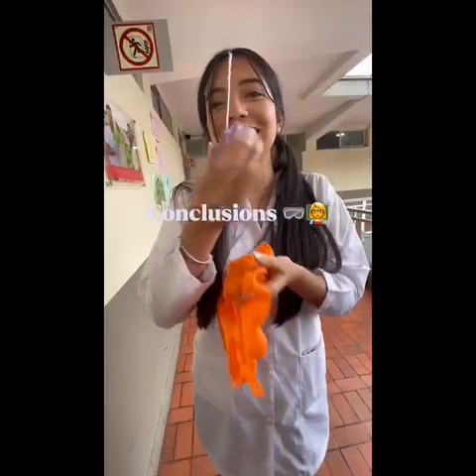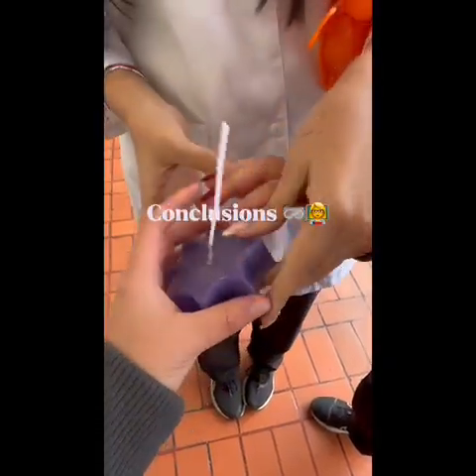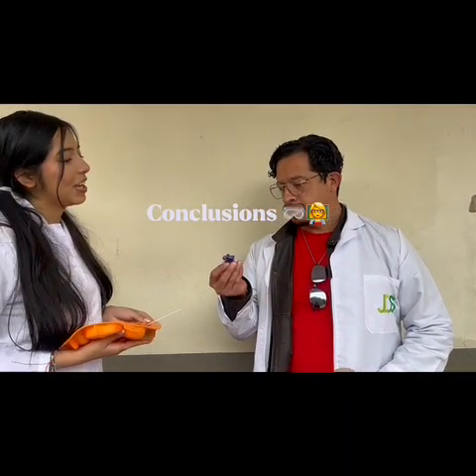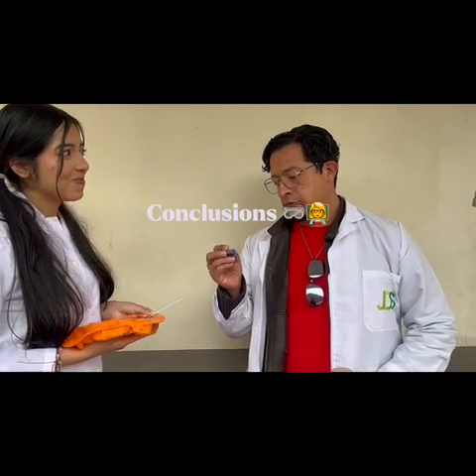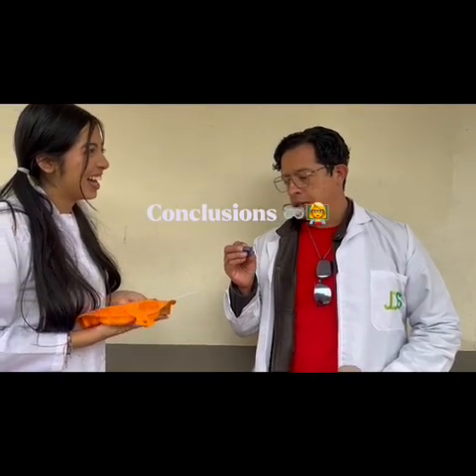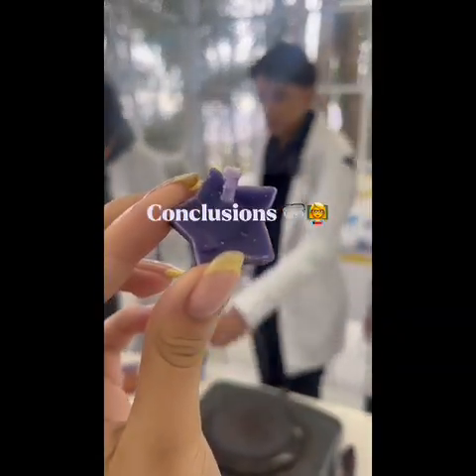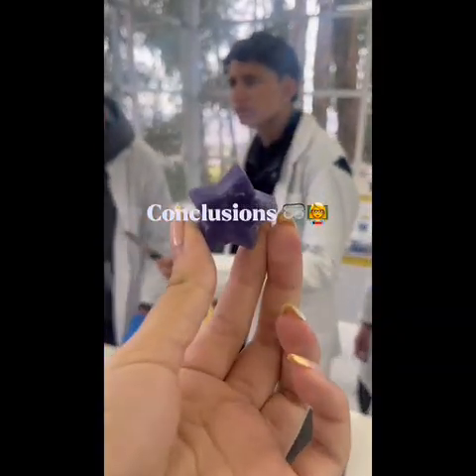Colorants were the only material that showed a physical change when added to the paraffin, changing the color. Next, when we mixed paraffin with ethanol, we saw a visible change between the soluble materials, while paraffin was insoluble in water, had very low conductivity, and no magnetic properties.